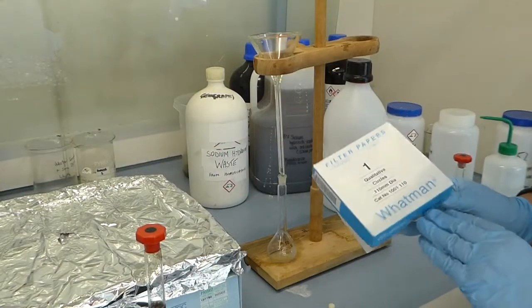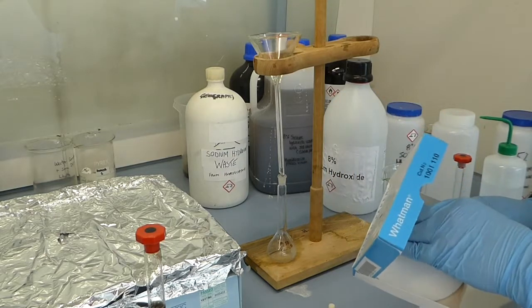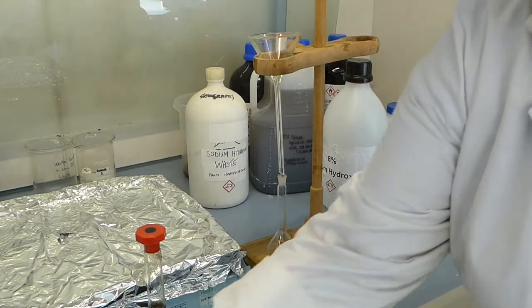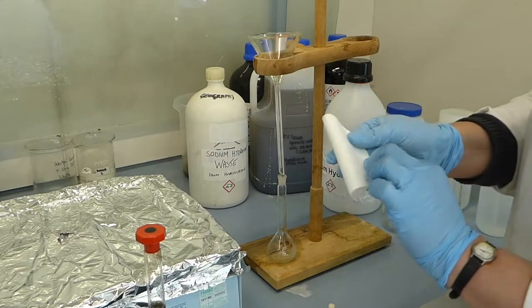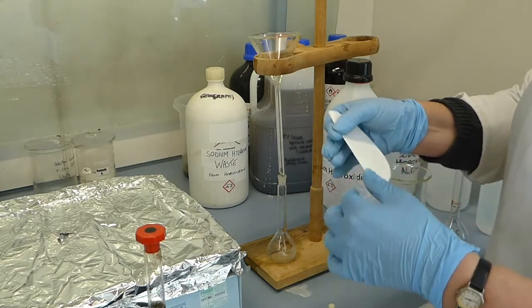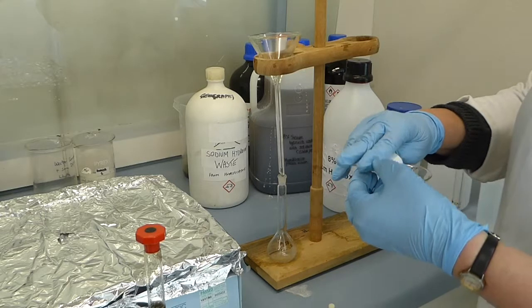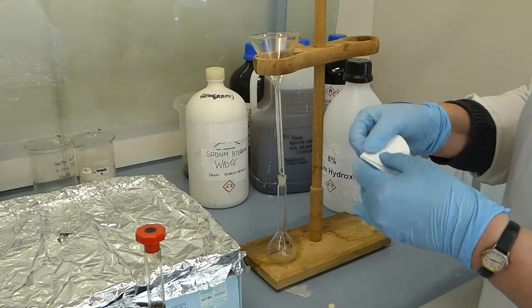Then take a Whatman number 1 filter, fold it in half and then in half again, and then you can open it out into a cone shape.